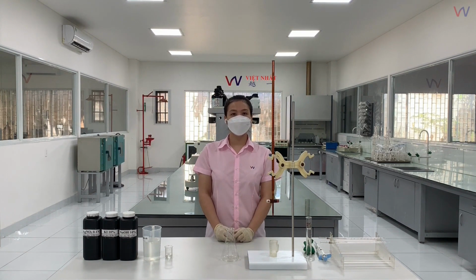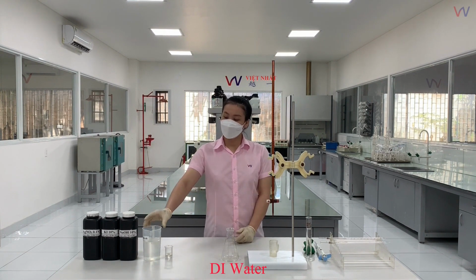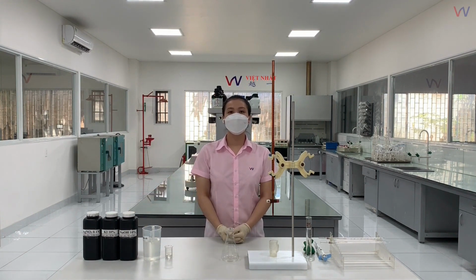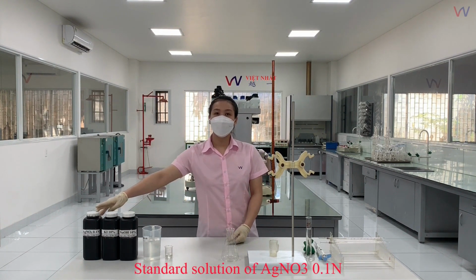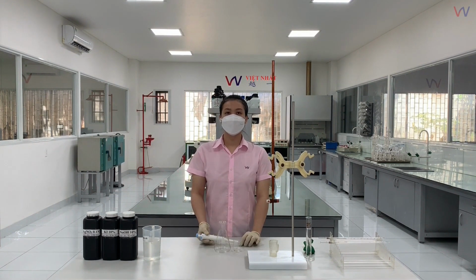The chemicals to be prepared are a sample solution, distilled water, 10% sodium hydroxide solution, 10% potassium iodide solution, and a standard solution of 0.1 N silver nitrate. Now, let's delve into the details.